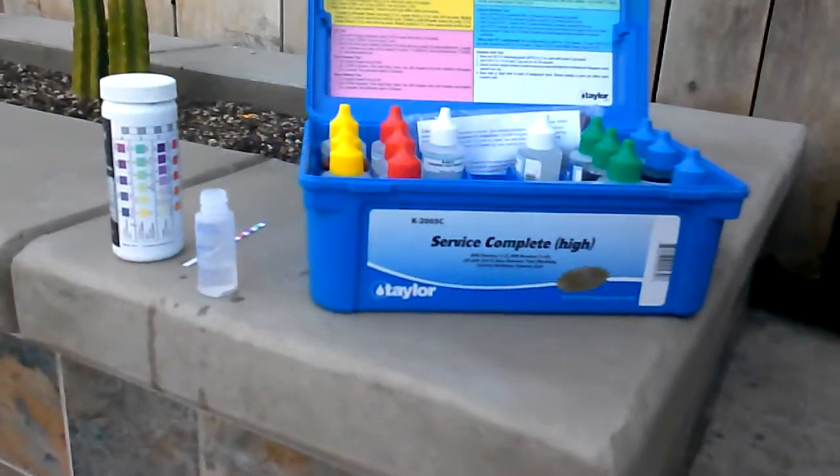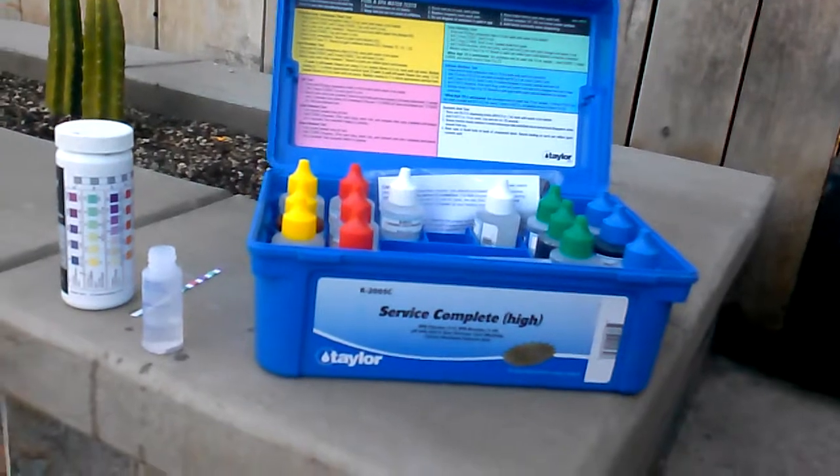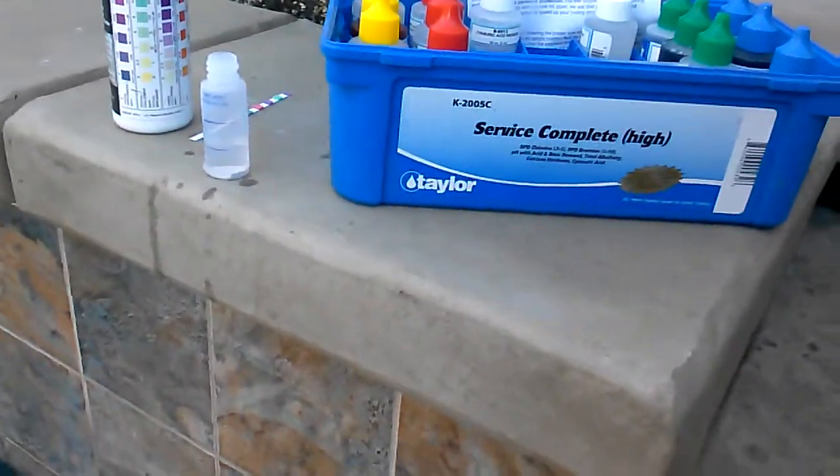Okay, using the Taylor Service Complete test kit, I'm going to be showing you how to test your cyanuric acid.